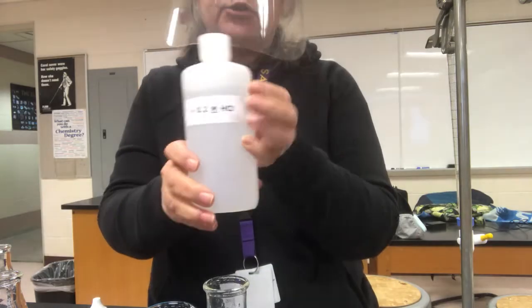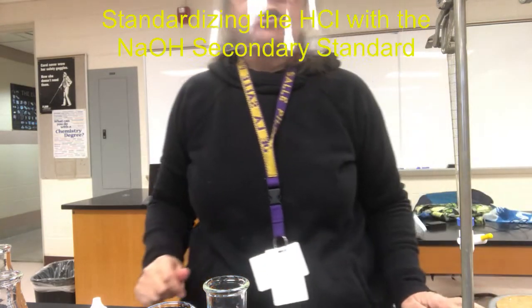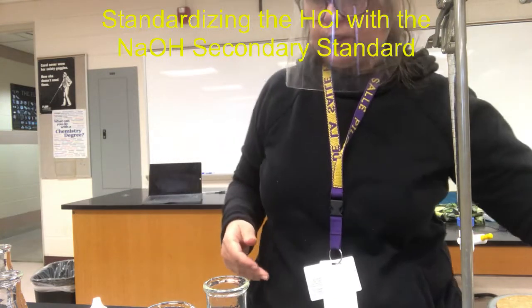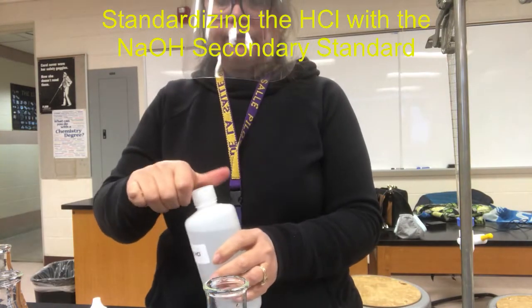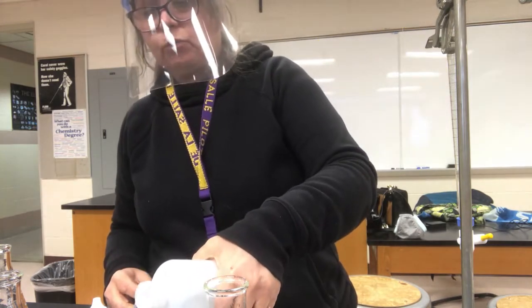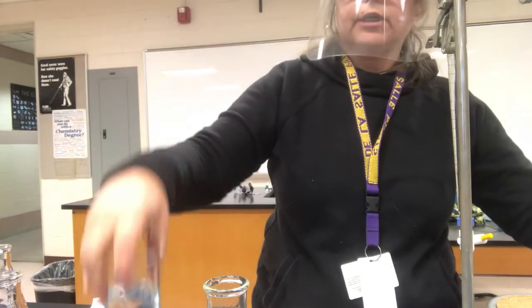Hydrochloric acid is so we can do our chemical analysis for sodium carbonate in the soda ash. So what we'll want to do is titrate the hydrochloric acid with the secondary standard that we have now, the sodium hydroxide. Now the sodium hydroxide concentration is known. So I'll put some of the hydrochloric acid out of my main stock bottle into a clean beaker.